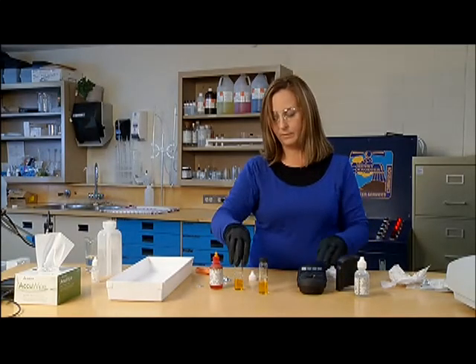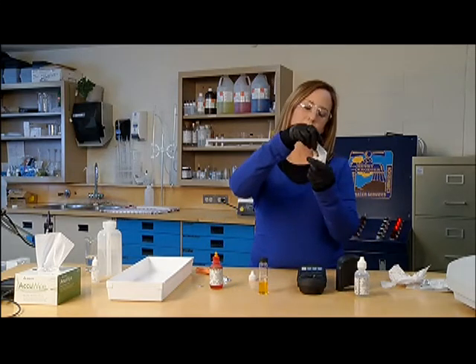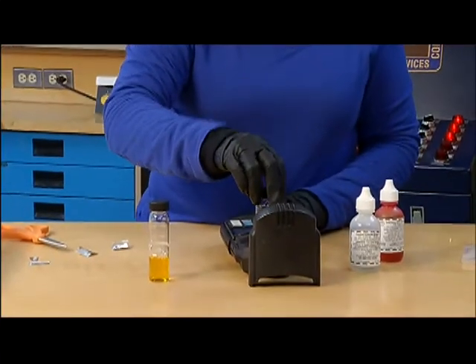The blank is then removed and the sample is inserted in the colorimeter per the manufacturer's instructions and tested.